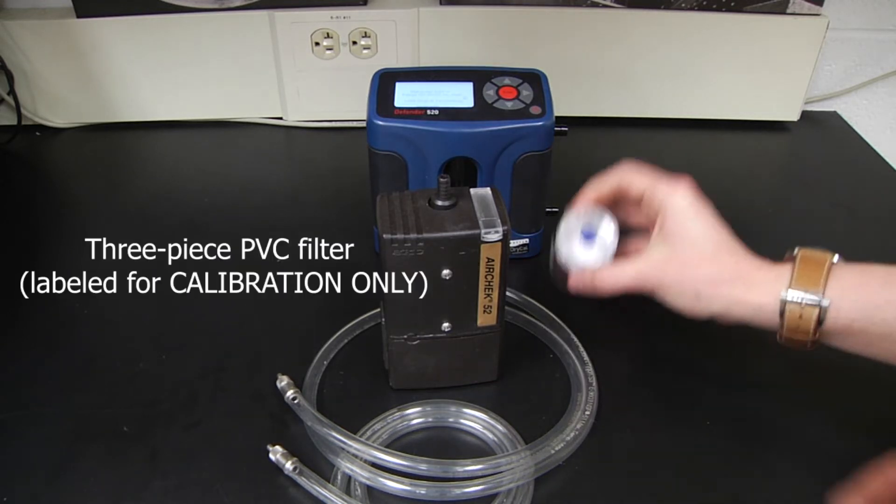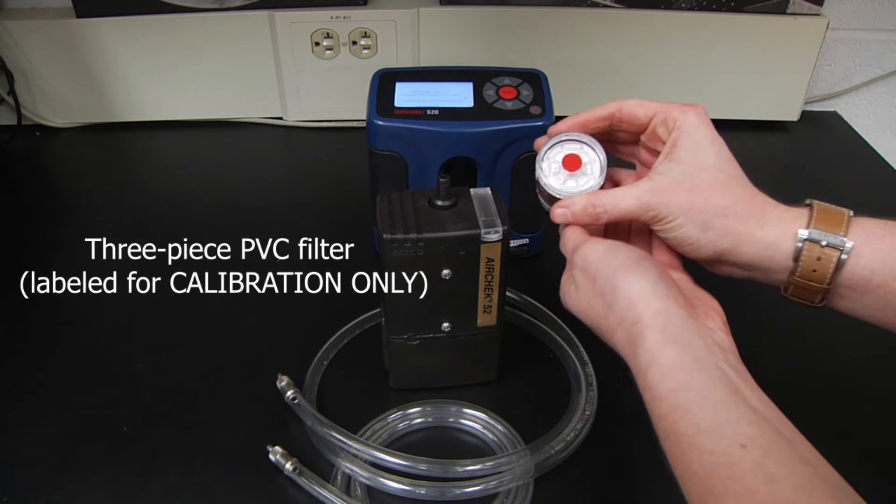To perform the calibration we'll use the same media type and sampling train, which is just our sampling setup, that will be used during our sample collection. But we won't use the exact same cassette.